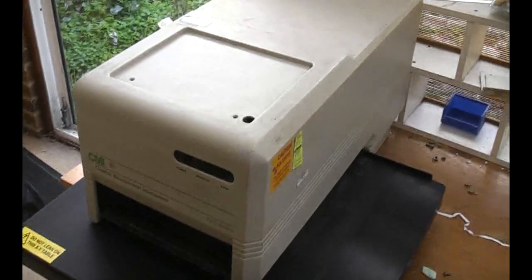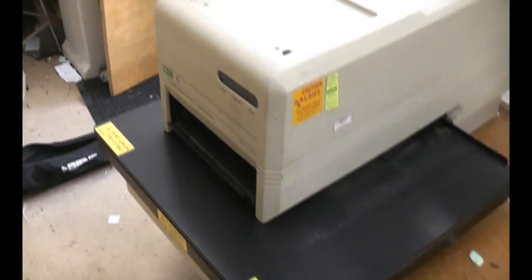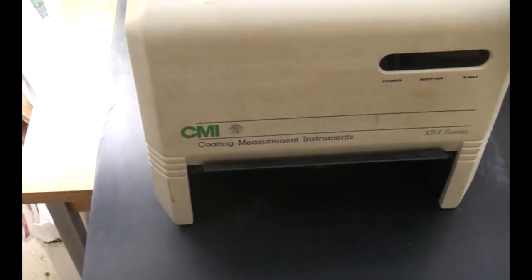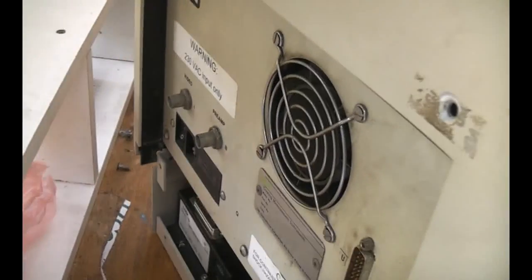There is something vaguely x-ray-ish in there, but it's not ridiculously heavy and not packed full of lead, so it's just about liftable on its pallet. The most obvious feature is an XY table. I gather this is for measuring characteristics of things like platings and coatings, possibly even foil on PCBs, using x-ray fluorescent spectroscopy. There's almost no user interface - it's clearly designed to be used with an external PC, with just a bunch of D-connectors on the back that would go into data acquisition cards.